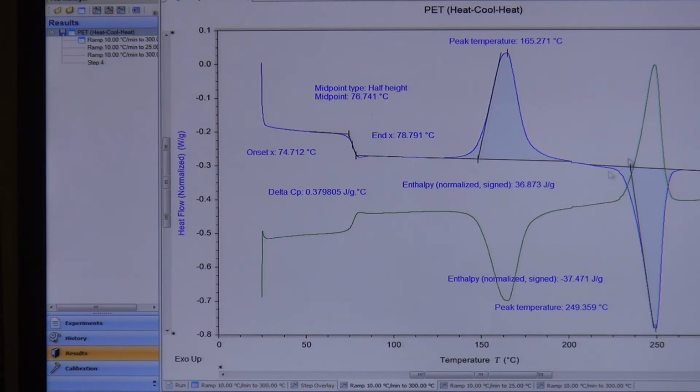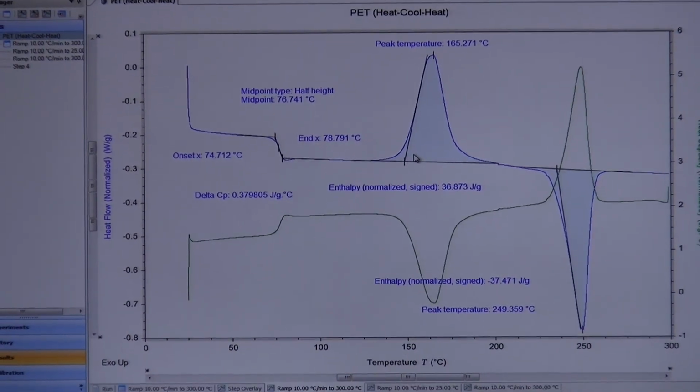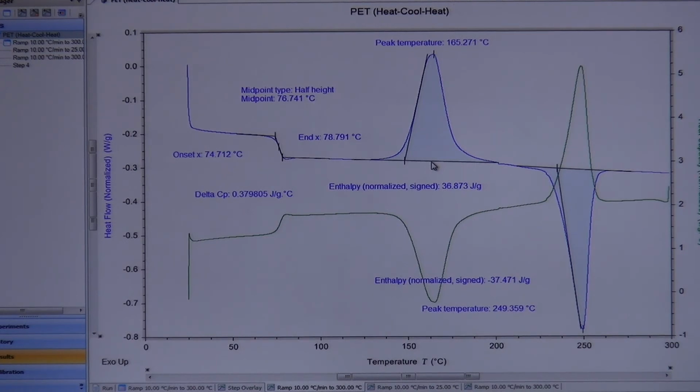So I would strongly suggest doing all of your analysis here or on Trios, and doing it exactly like I did it here. Just have all the numbers in front of you. You can save the file so that it will open up exactly as is. You can save the PDF, whatever your favorite way is. And then you can take your raw data and replot it somewhere else and simply just add these on afterwards. If you try to do these analyses in other, more generic software, it simply just won't really work, or it would require a lot of your work to make it make sense. So it's just much easier to do it through this. And like I said, this software is free, so there's really no cost to just doing it here. Okay.